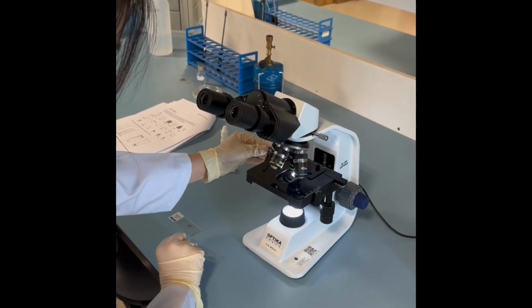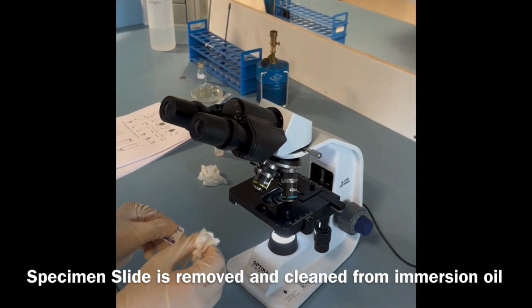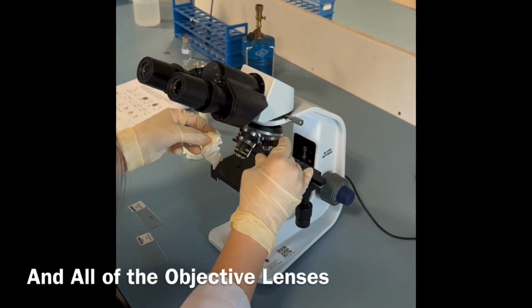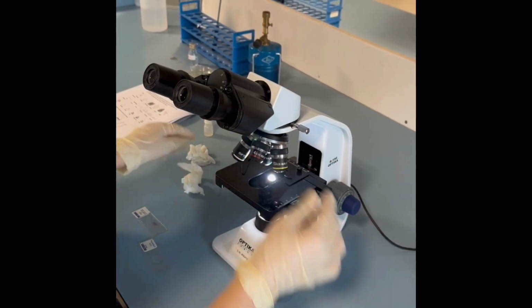So wrapping everything up, the specimen slide is removed and cleaned from immersion oil with the lens tissue, lens paper, and all of the objective lenses, that includes 10 magnification, 40 magnification, and further on.